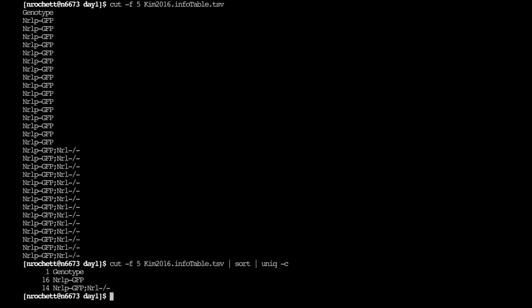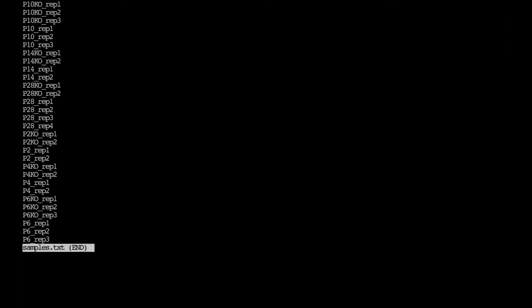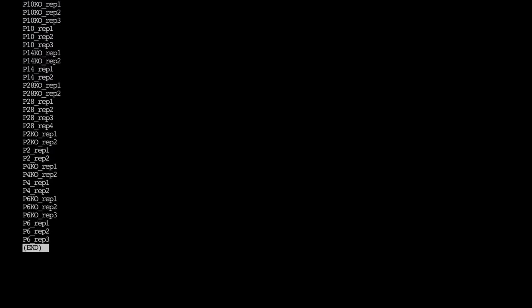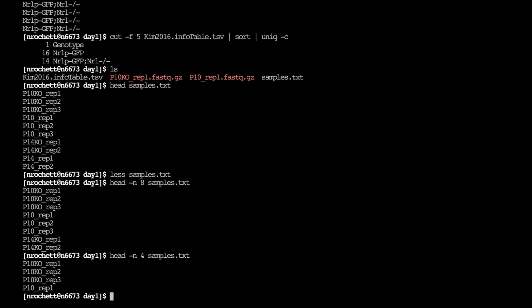One more thing I can show you, and one command that's also extremely useful and you have probably seen before, is the head command. And so you just type head samples.txt and you get the first 10 lines of your file. So it is an alternative to less. Some people by default do head on their text files. I prefer doing less, just because it gives me more options. But yeah, so here, this is the entire file. And then when we do head on it, we get only the first 10 lines. And then we can choose how many lines we want. So for instance, if I just want the first 8 lines, then I do head -n8. Okay, if I just want the first 4 lines, then head -n4.